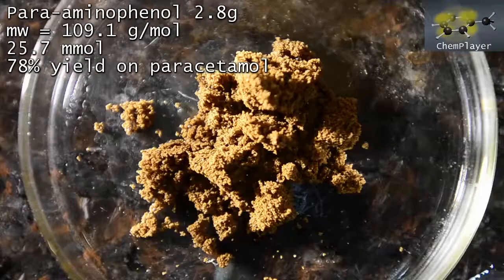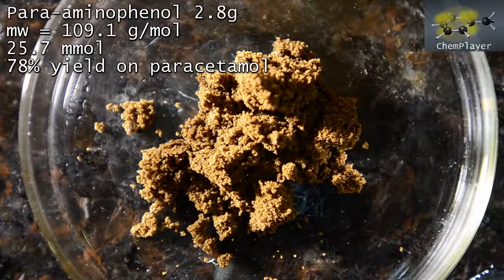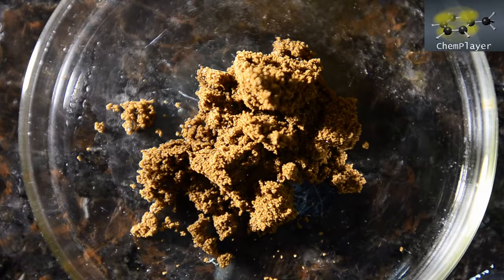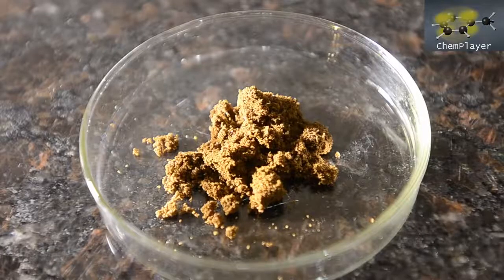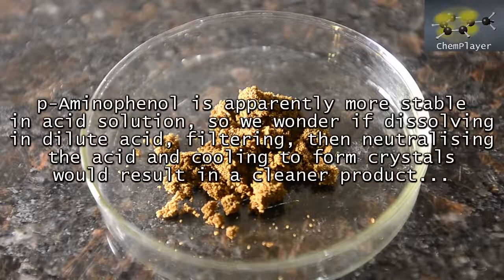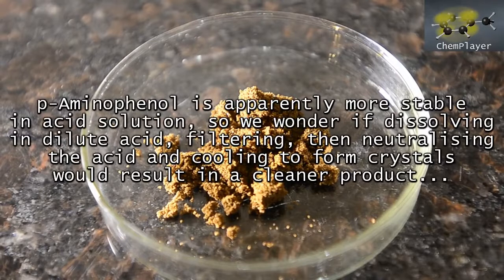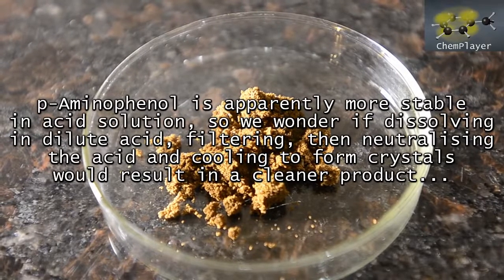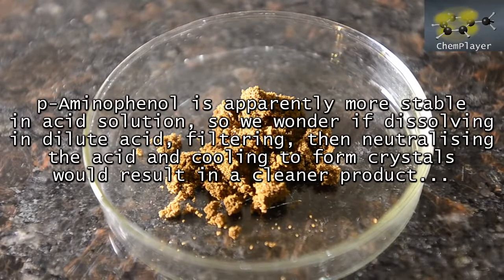Remember that some of the weight in the original reactant is lost as we hydrolyze and remove the acetyl group. So this isn't bad. We'll try this in the follow-up reaction and see just how pure it is. There are probably some other options as well, like dissolving it in dilute acid, and then neutralizing and precipitating out like we did before. The product might be more stable in an acid solution, so perhaps this will give a cleaner looking product.